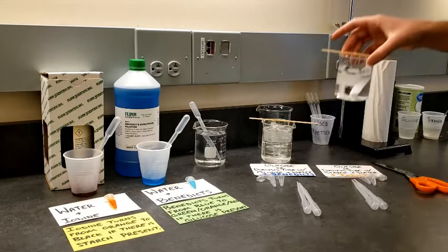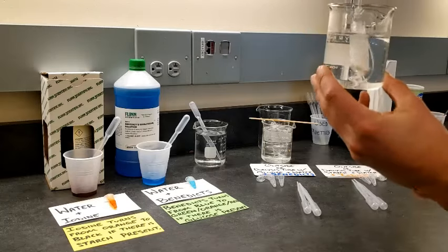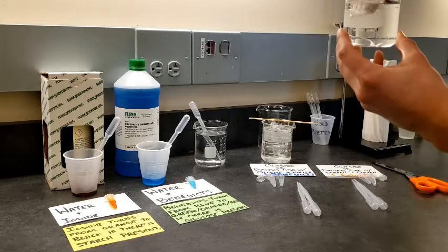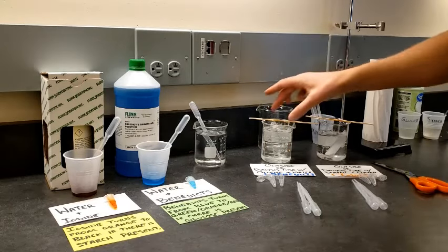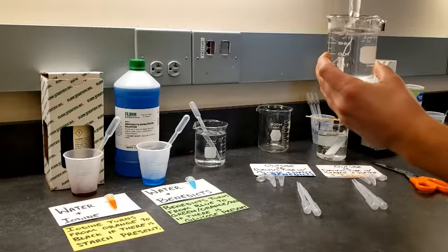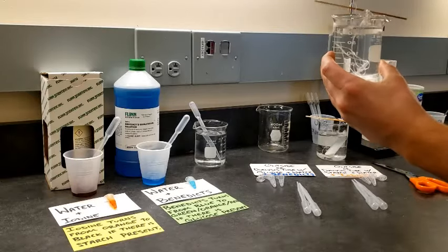Remember the setup that we used for the dialysis tubing last lesson? This had the starch and the water on the inside of the dialysis tubing, but the one that you guys did not see me put together was this one right here. So this is just sugar water, glucose water, and I placed it into this beaker that had pure water.